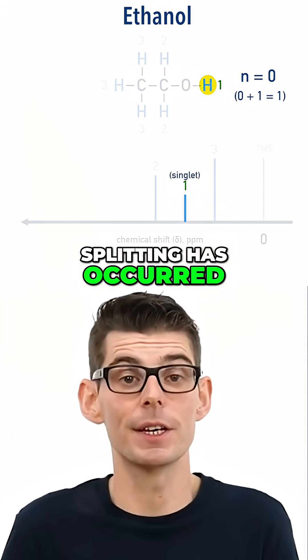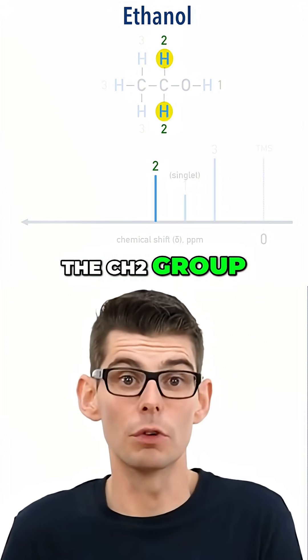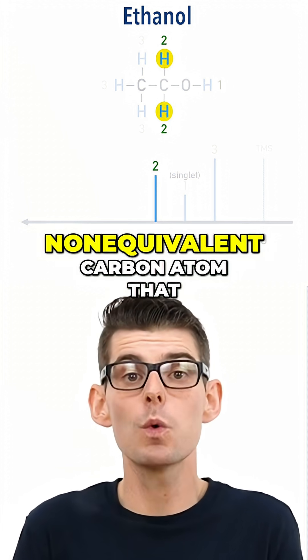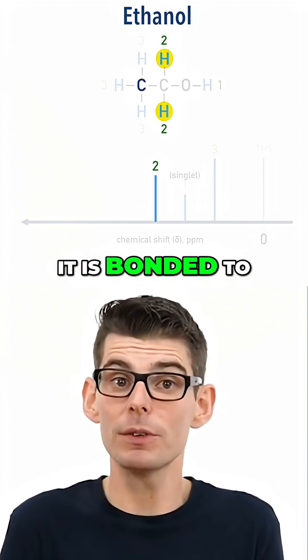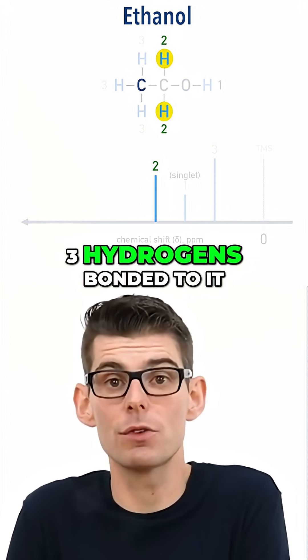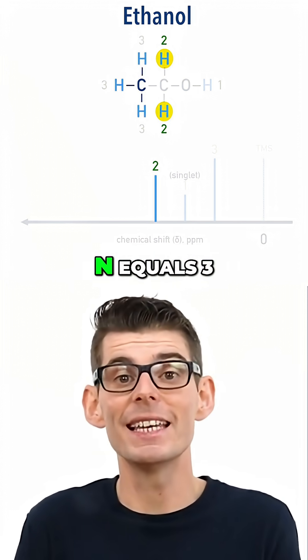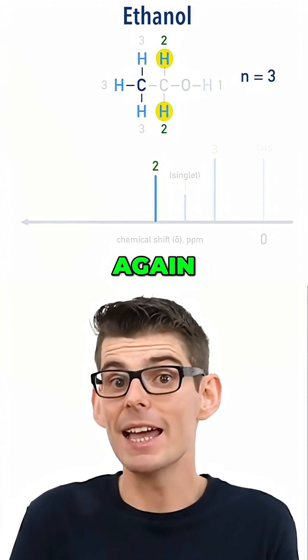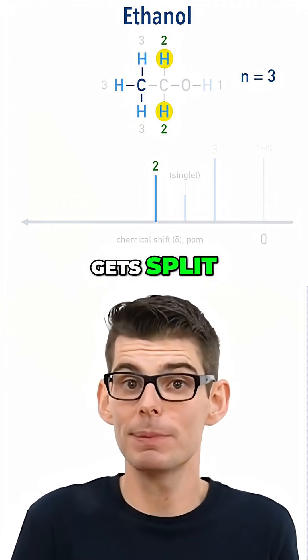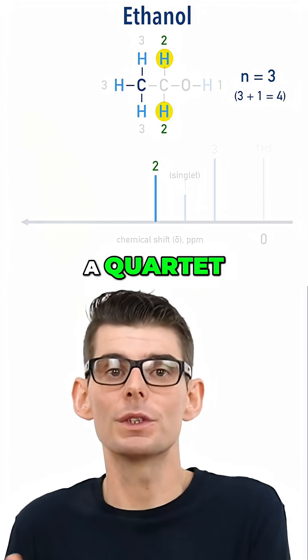The second hydrogen environment, the CH2 group, does have an adjacent non-equivalent carbon atom that it is bonded to, and this carbon has three hydrogens bonded to it, meaning here n equals 3. Again, n plus 1 is the number of times the peak gets split — 3 plus 1 is 4, a quartet.